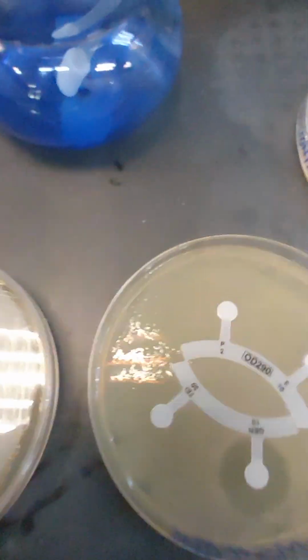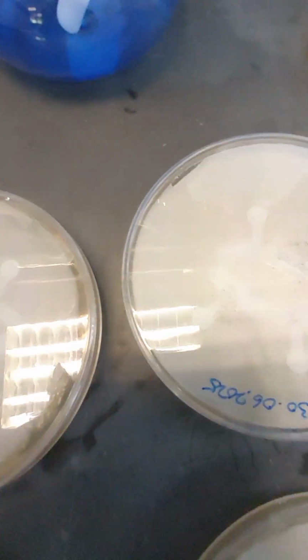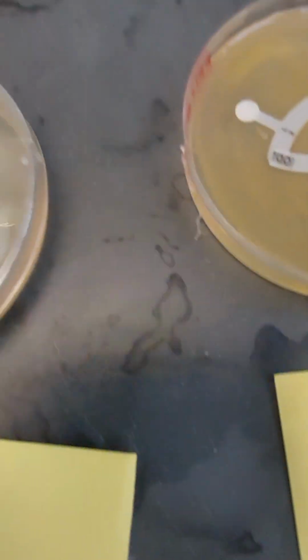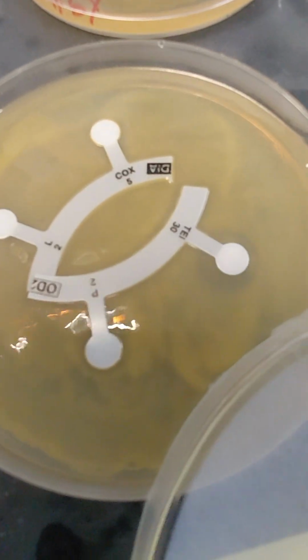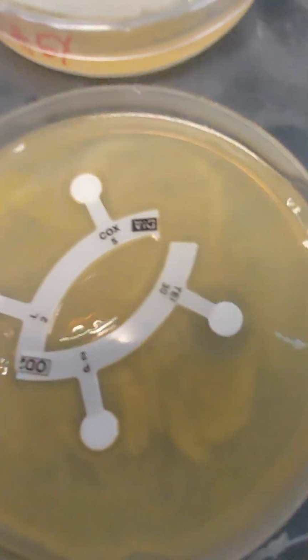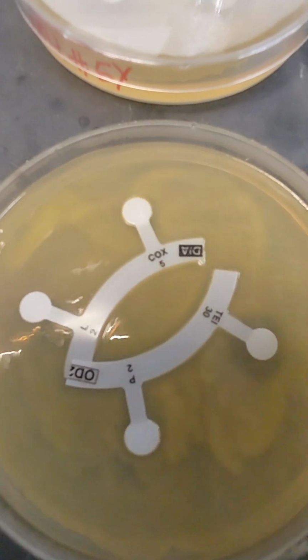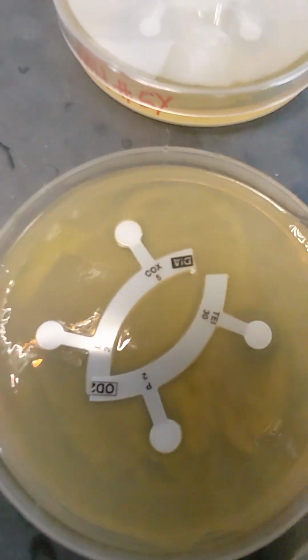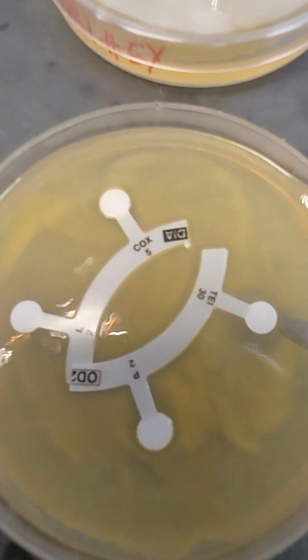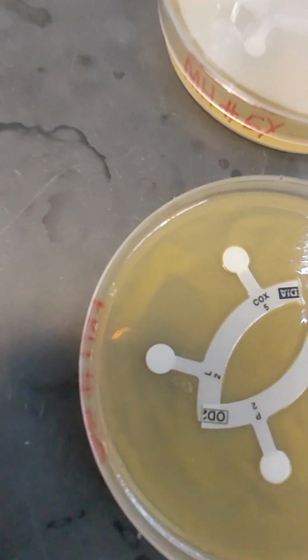And this one, again, gentamicin, the rest resistant. Okay, let's look at the next strain here. So we have number 5Y. Now I've given the code Y because it's yellow. Let's look at it closely. Okay. Again, we see it appears to be growing quite well with the exception of this particular antibiotic. I will check the codes later and we'll record this result. So there is a zone of inhibition around this particular disc, but it's not significant because it's quite a small zone.